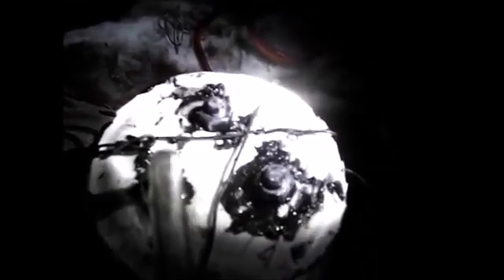This cell came from a hydrogen torch I was building — it kind of blew up, but we'll get to that. I've got a couple of lead rods, or lead bolts, that I made and threaded some nuts on so they could stay in the lid of this jar.